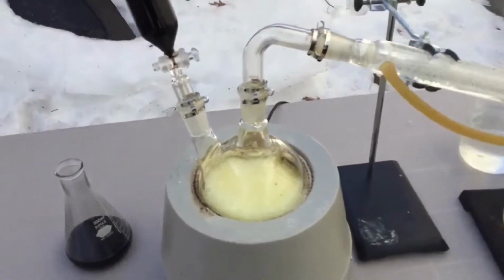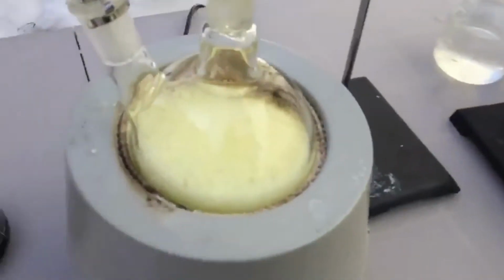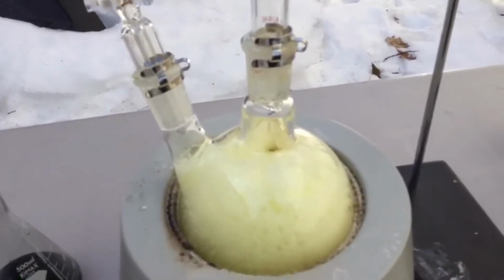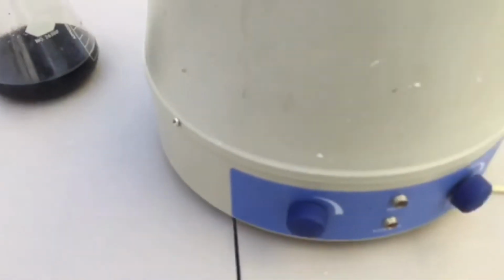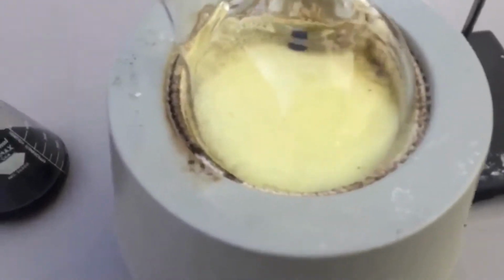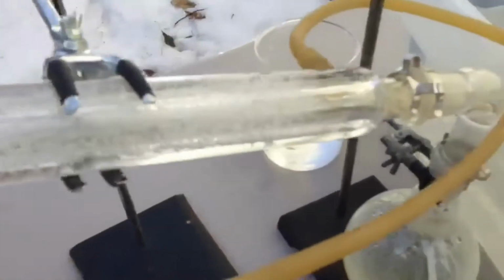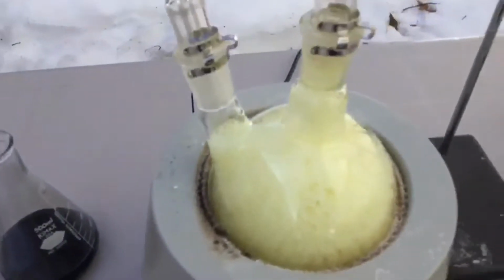Alright guys, quick update. Everything's going great except this one thing where it just keeps frothing over every 15 seconds. Here, I'm going to show you. As you can see, it almost does. I've got the heat turned off now because I'm going to separate this into 2 batches. When the first batch is done, I'll add the second one and keep adding sulfuric acid, because I don't want to ruin too much of my final product. Even though I will distill this again, it's going way too slow.